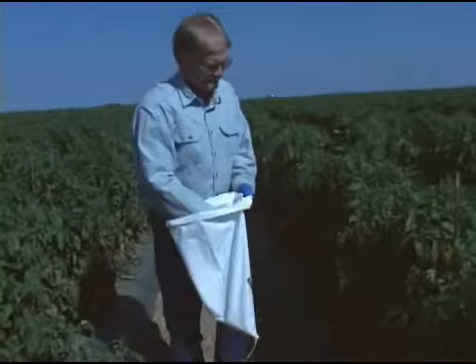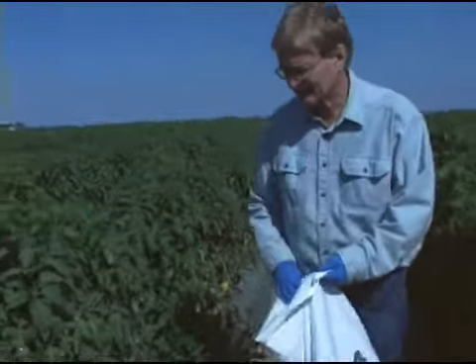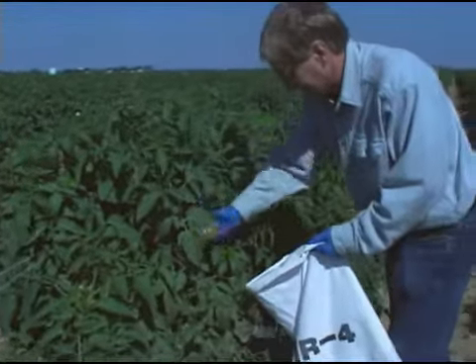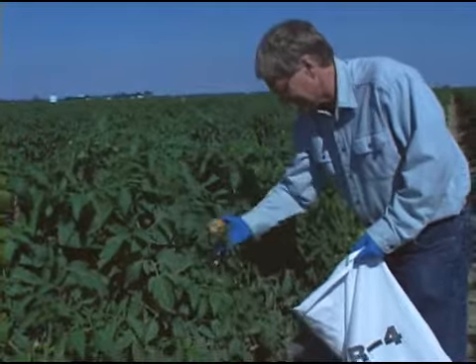Put the fruit in the IR-4 plastic-lined sample bags you received. Make sure each sample bag is labeled properly with the correct date and sample ID number. You should repeat this procedure a total of 4 times for the untreated control plot.